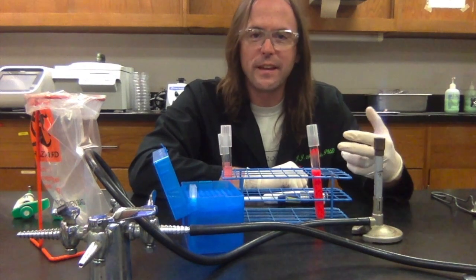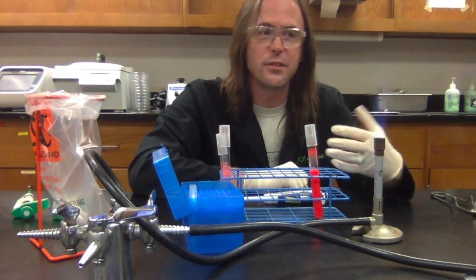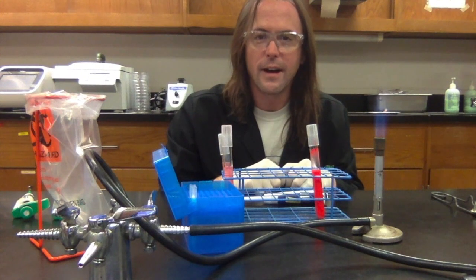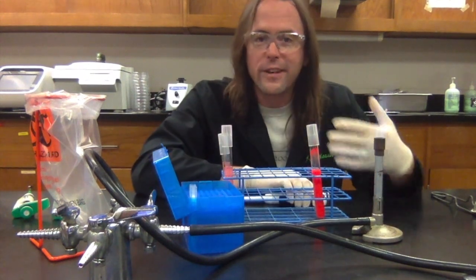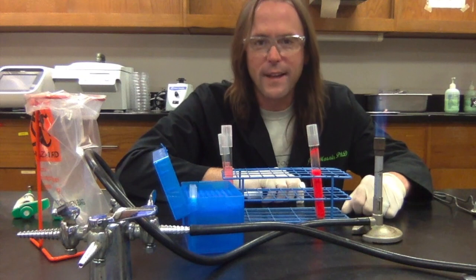It's especially easy to actually singe the hair off of your knuckles, that sort of thing, just by not paying attention to where your hands are. So always make sure that you know where your hands are, you know where your pipette is, and that you don't get burned. The other one is if you pipette too vigorously, if you get carried away and you want to just really start hitting the plunger and getting everything done faster.